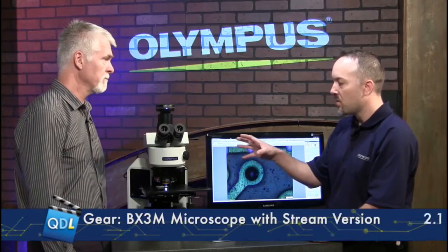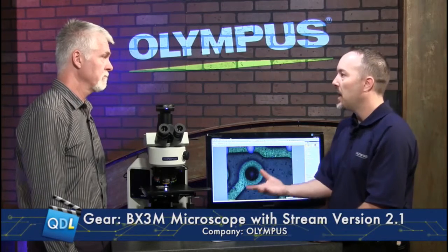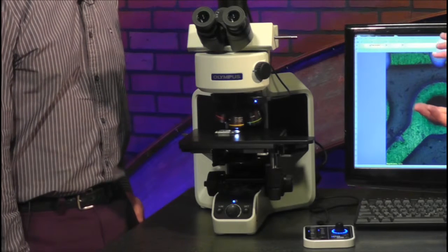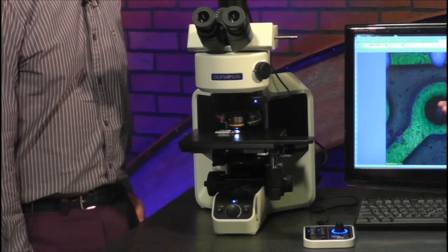With encoded Z, the software can stitch images in Z and render three-dimensional images with height data measurements. Motorized control, fluorescence illumination, and different objectives can all be added on at any time. Most of the time we'll customize the tool and get the right illuminator knowing where you might want to grow with the system. That's the BX53M microscope and Olympus Stream 2.1 — thanks to Rob Bellinger of Olympus.